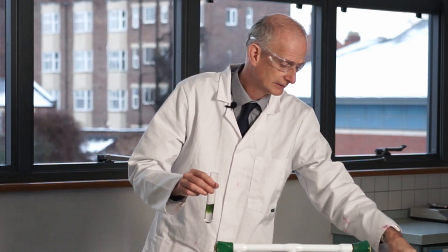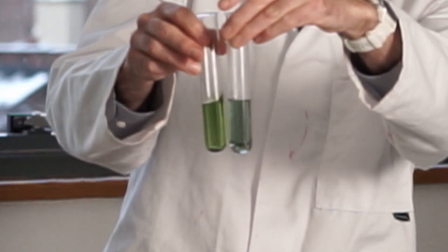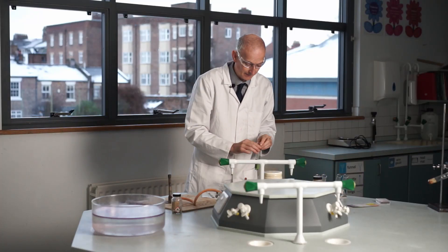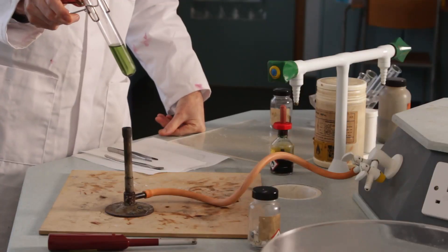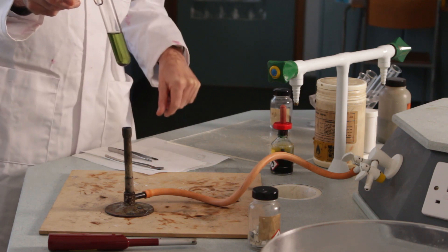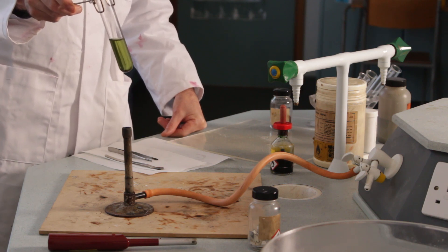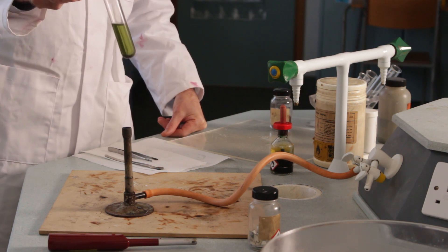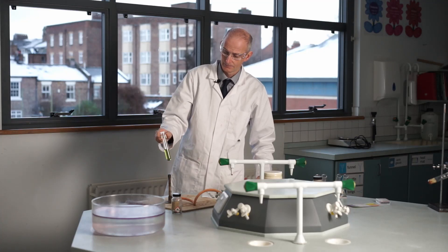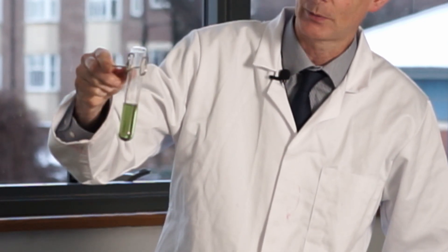That's a nice green colour. Look — a little comparison: the magnesium one is definitely slightly away from green towards blue. Then let's give the iron a bit of heat and see if there's any impact. It's bubbling because the water at the bottom is starting to boil, but it doesn't seem to be carrying on when I take it out of the flame. No reaction — can't spot any bubbling.